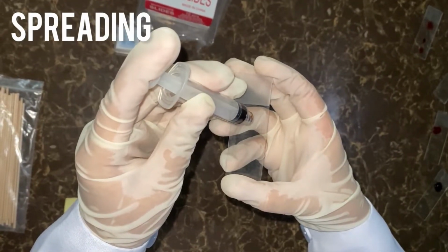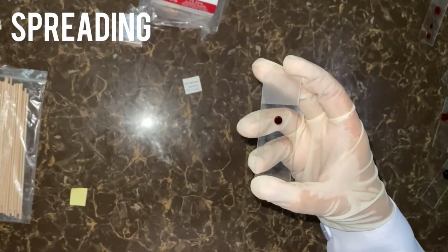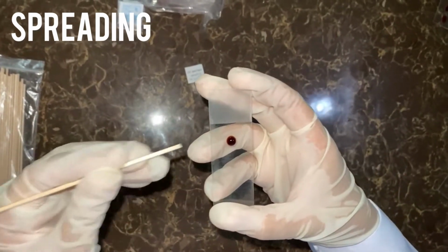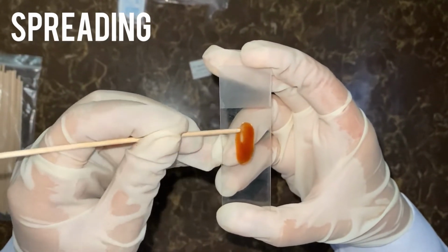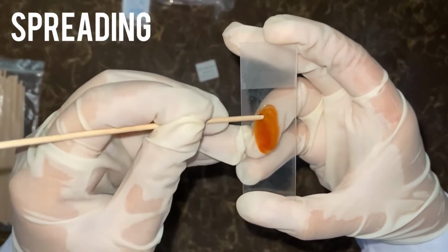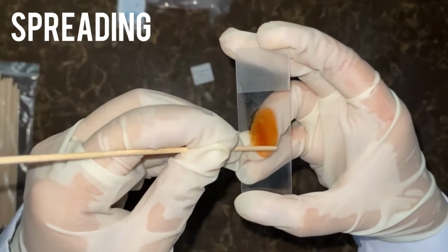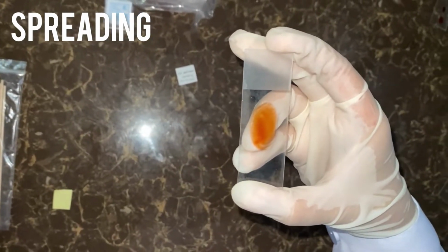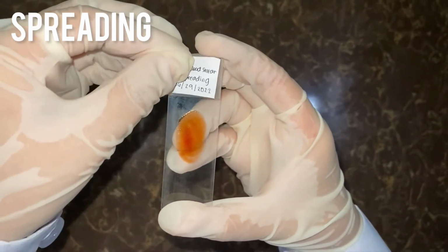Spreading. First step is to transfer a small amount of the sediments on one end of a clean glass slide. Second, using an applicator stick, spread the sediments throughout the slide. Then with a circular motion, gently spread it into a moderately thick film using an applicator stick. Third, label your slide.